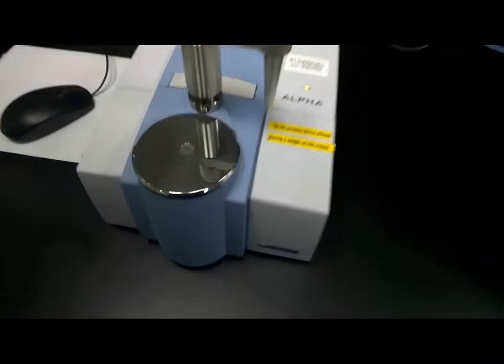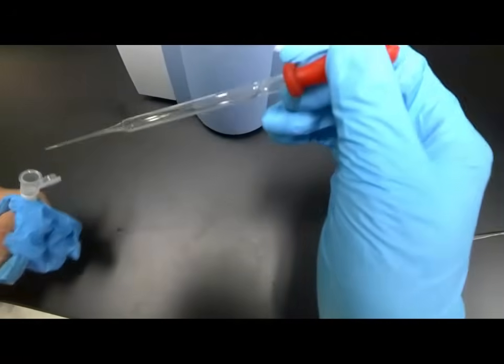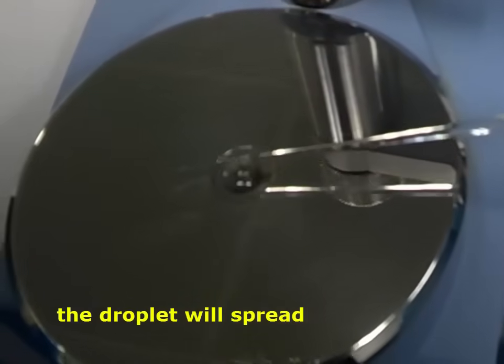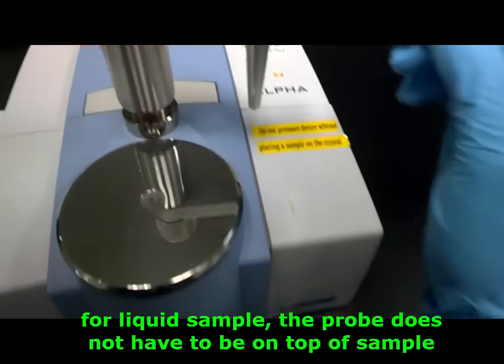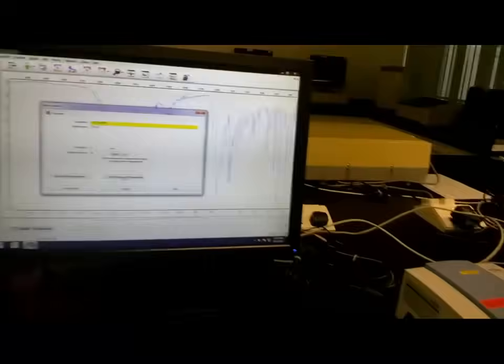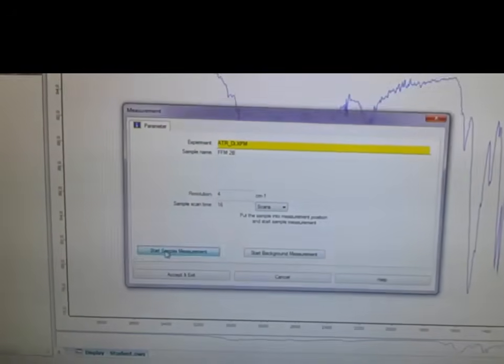For the liquid sample, we need a glass pipette or glass dropper. Pinch the bulb to draw in some liquid — just a bit will do, because you need only a single drop. A single drop will spread and cover the whole surface of the scan area. Please don't add too excessively. You see, it's all spreading. For liquid sample, there's no need to rotate the knob — just keep it in place as shown here. After the background scan is done, just keep it there. Check that the resolution is the same and the number of scans, and then start sample scan.